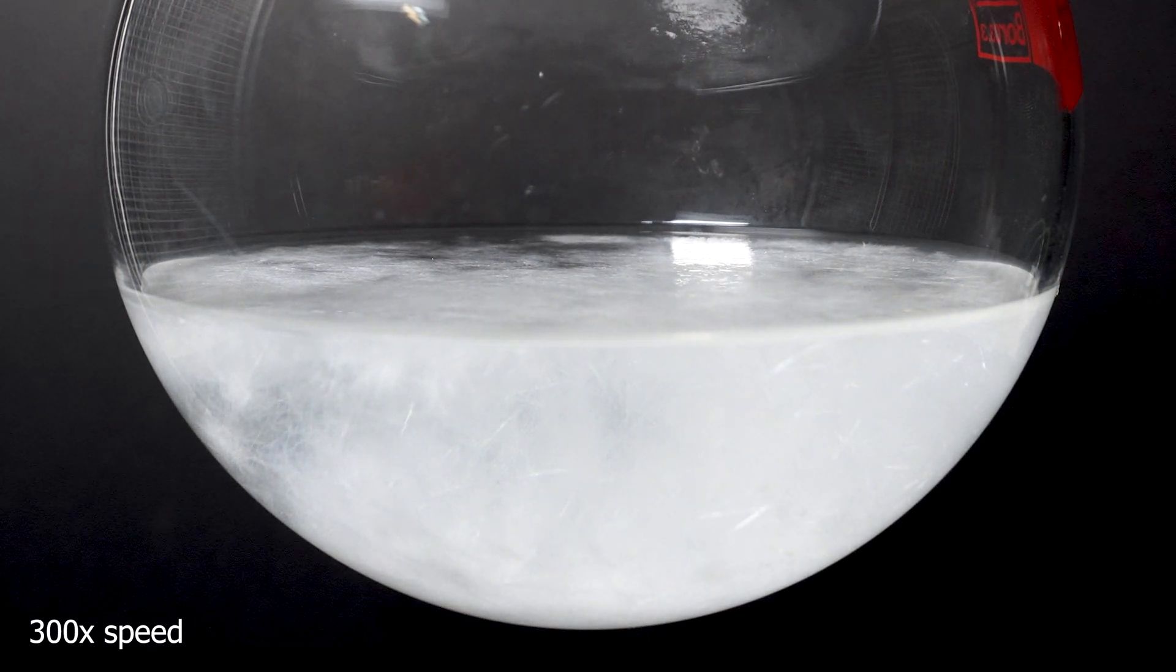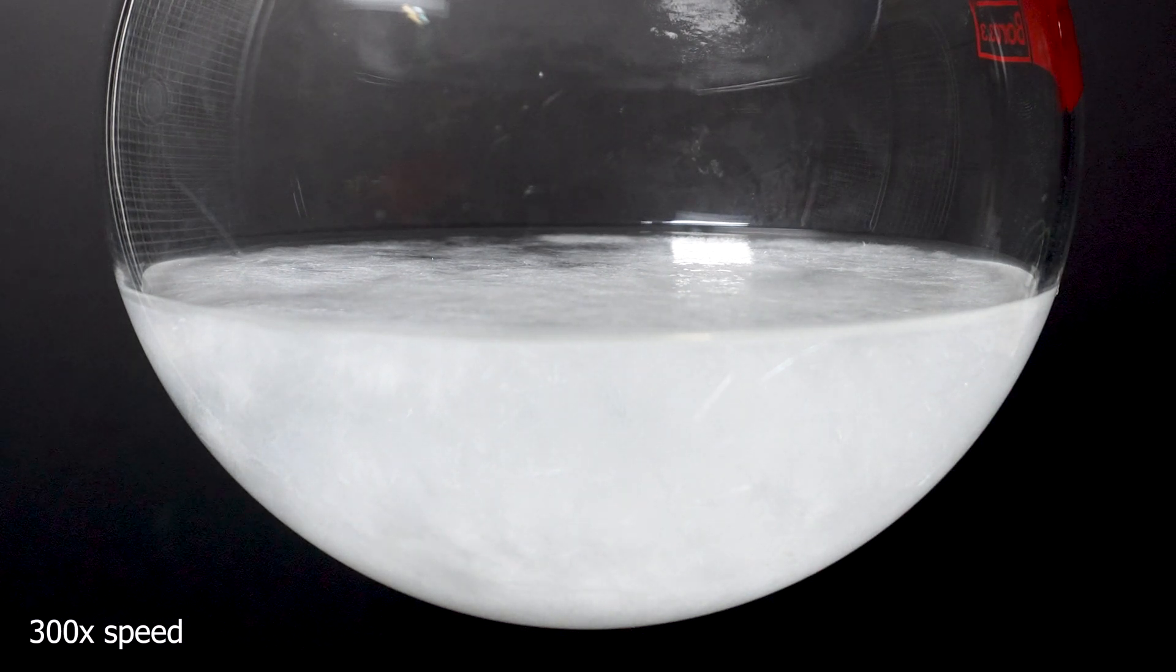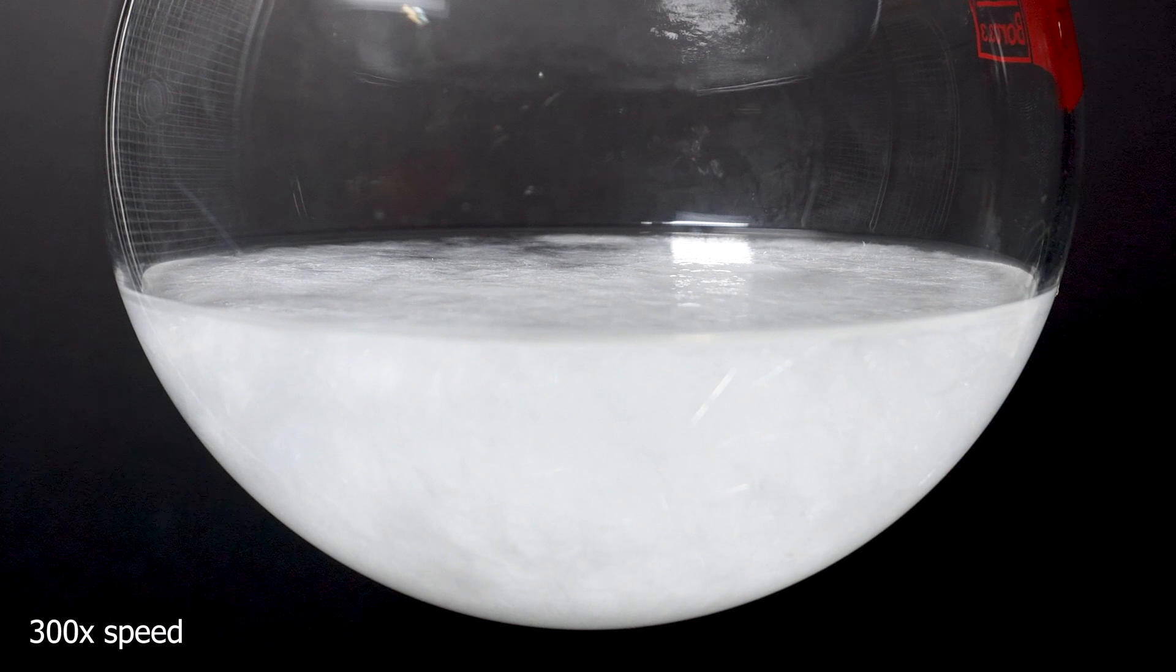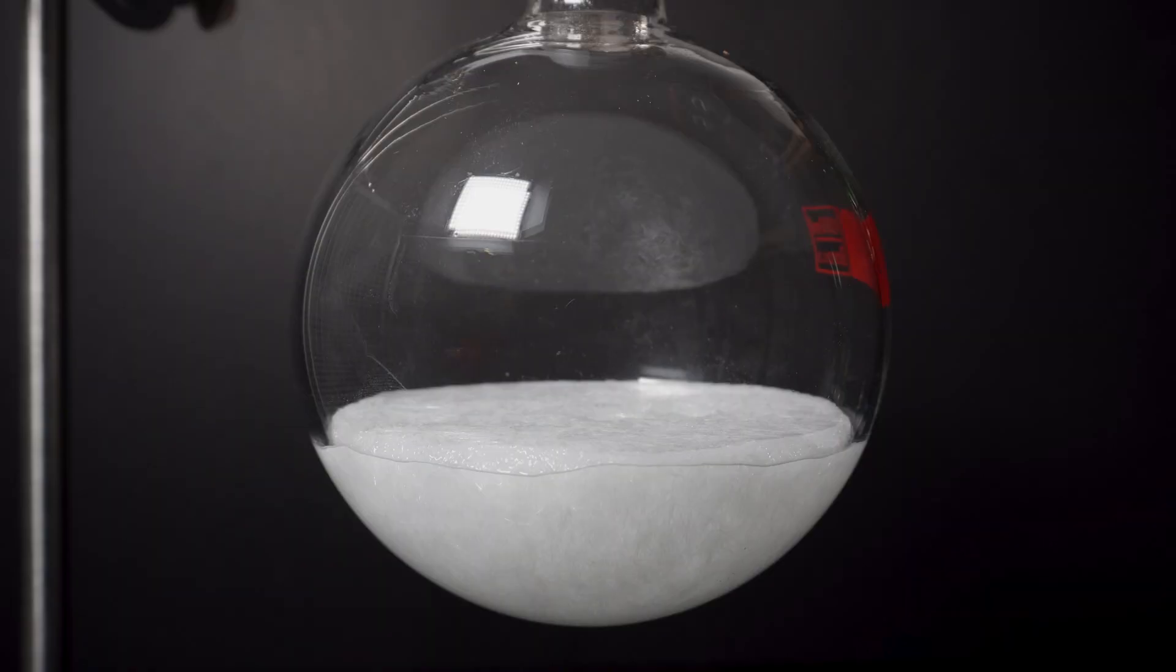I wasn't prepared for how fast the crystals formed so I missed filming of the very start of the crystallization. Right when I noticed it I turned on my camera. This video is sped up however the entire flask crystallized very quickly.